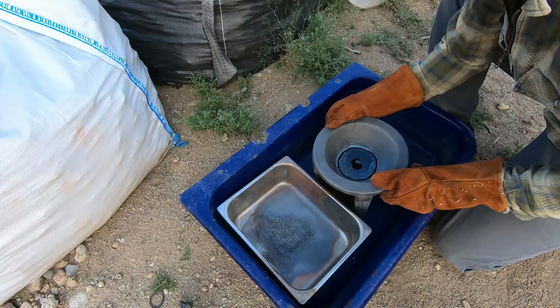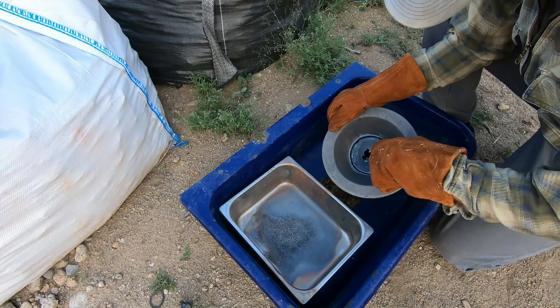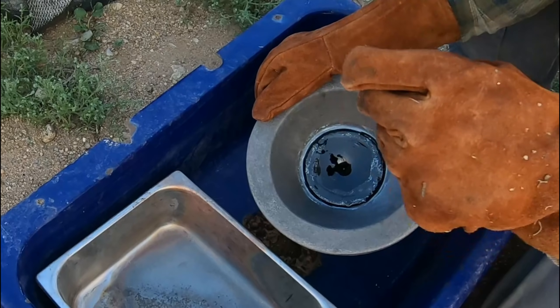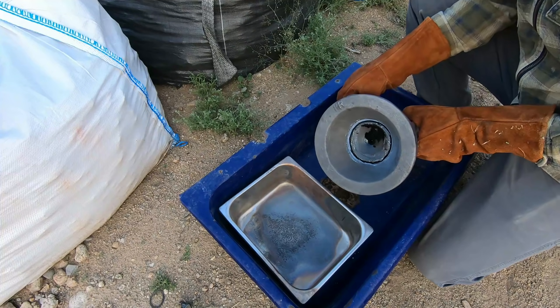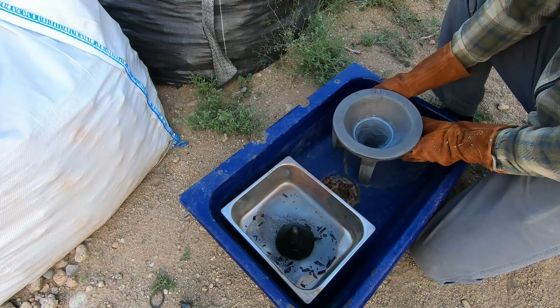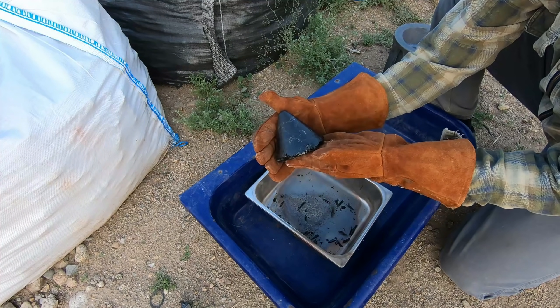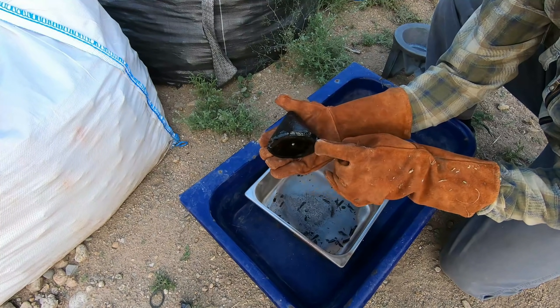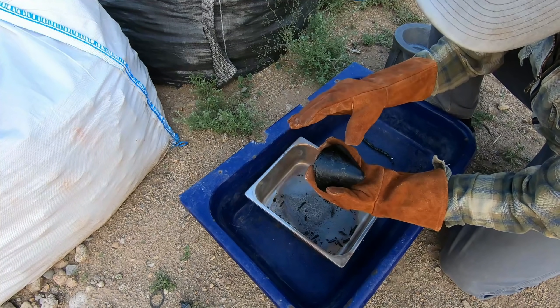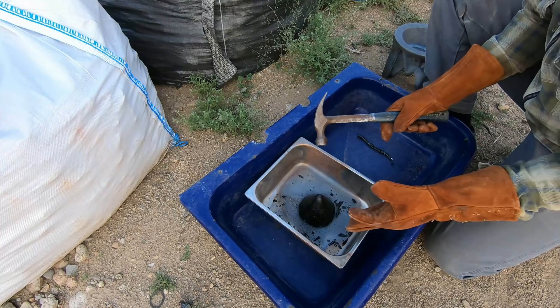Here's our second pour — I think it's cool enough. You can see it's really glassy this time around, black, clear, and glassy. That's good. Hopefully we won't have a matte layer down on the bottom. Here again is the button — look at that thing. We got a solid glass up here, which is good. Hopefully we won't have a matte layer and we'll have a nice clean button down. Still pretty darn hot.